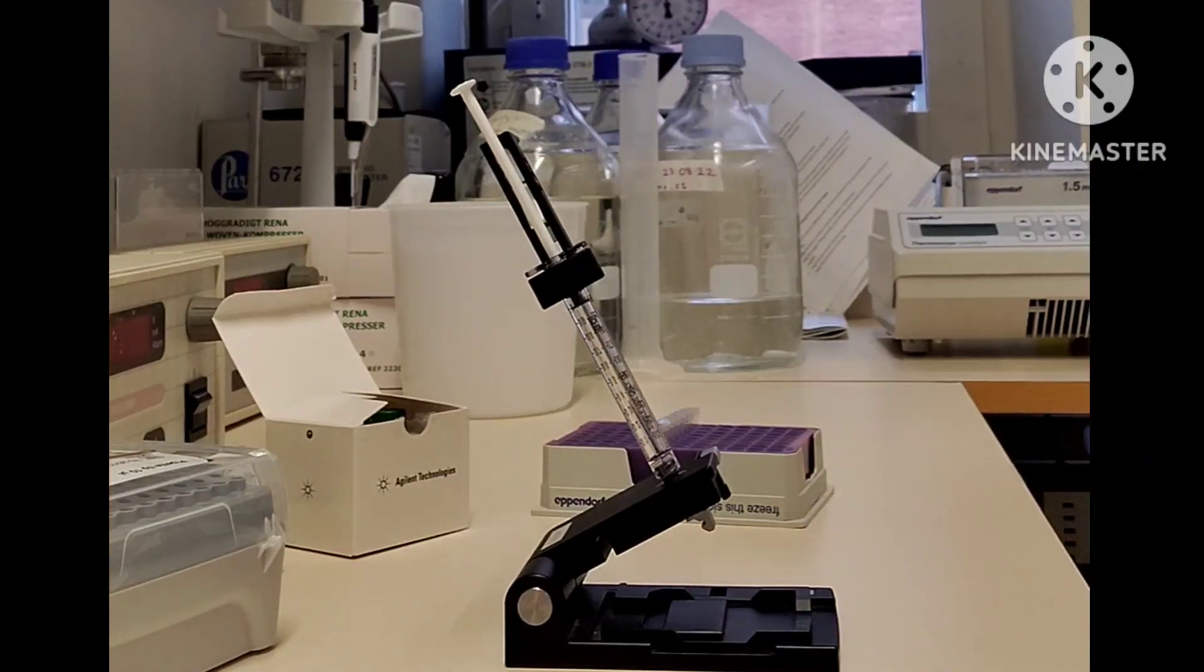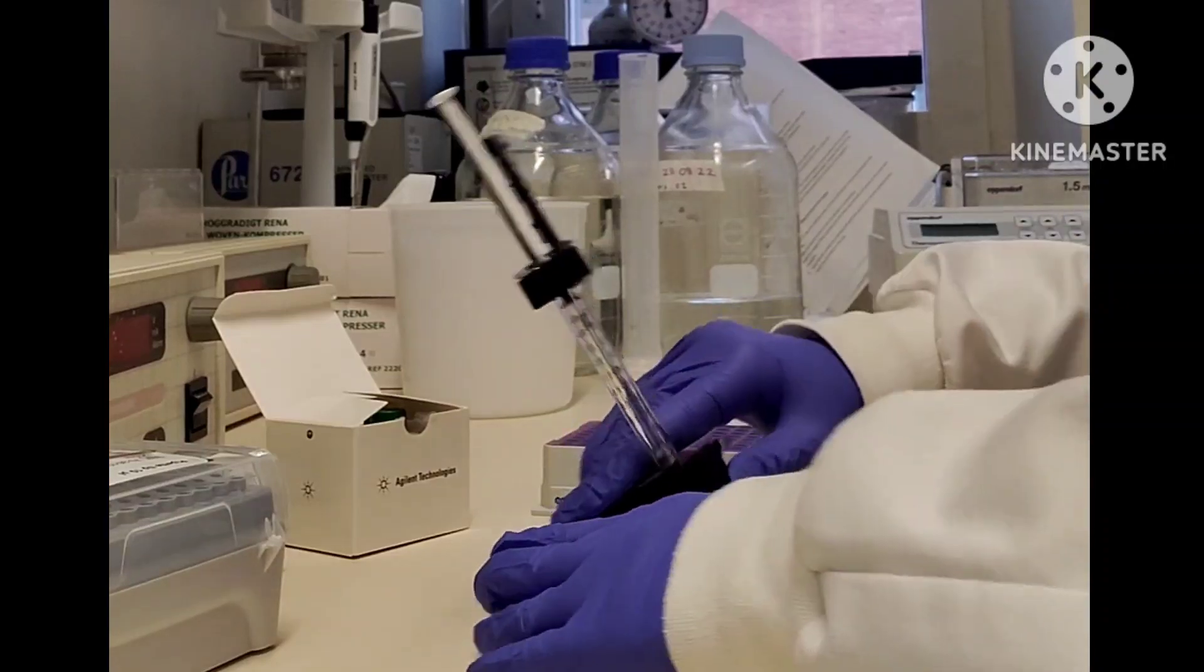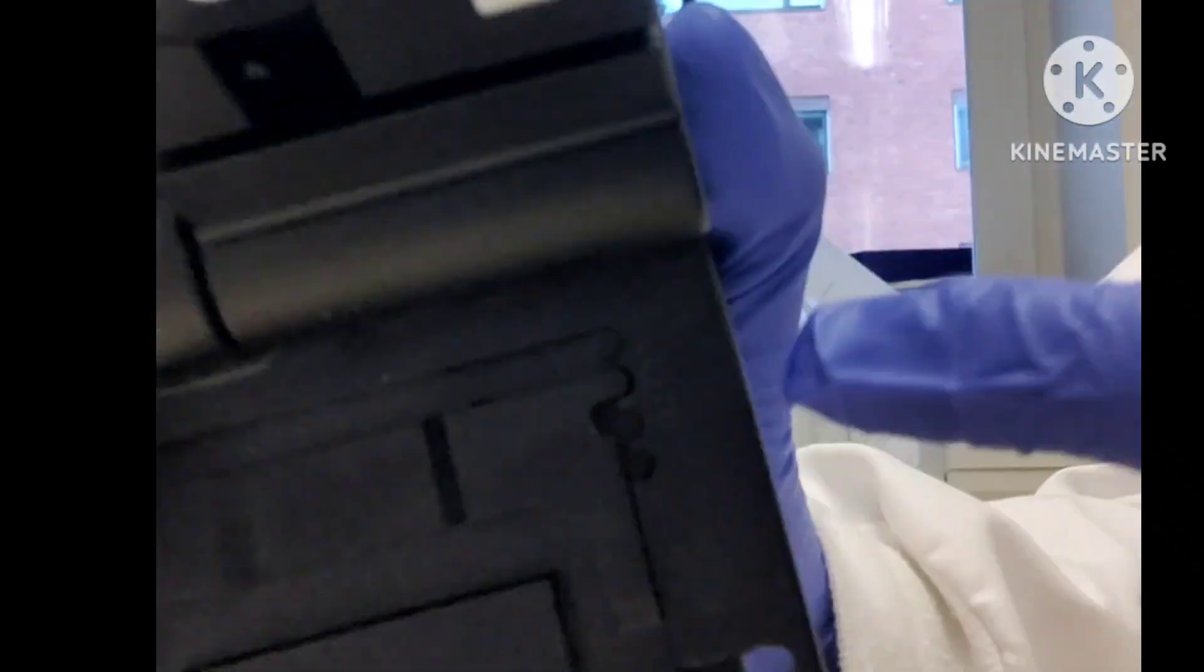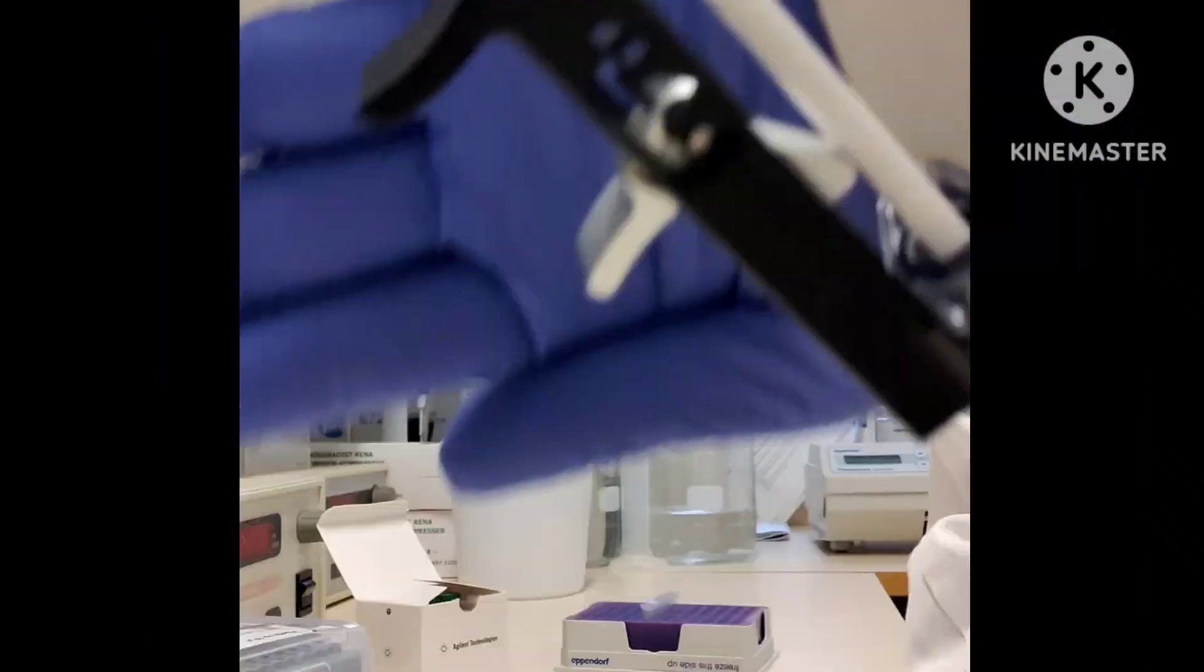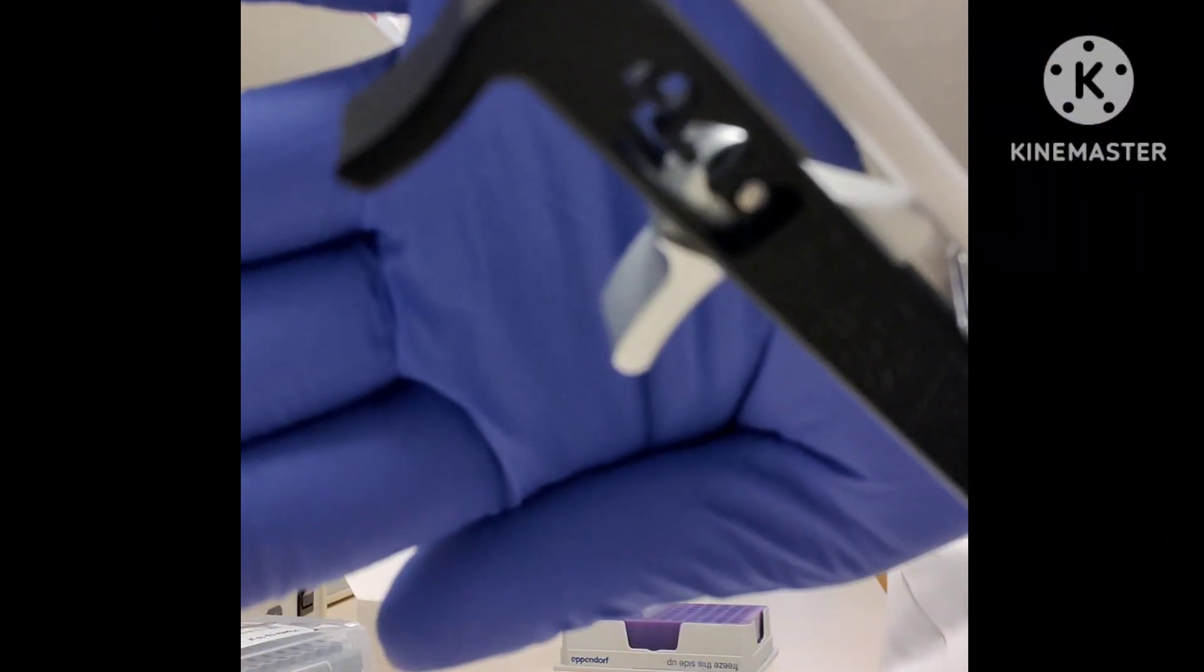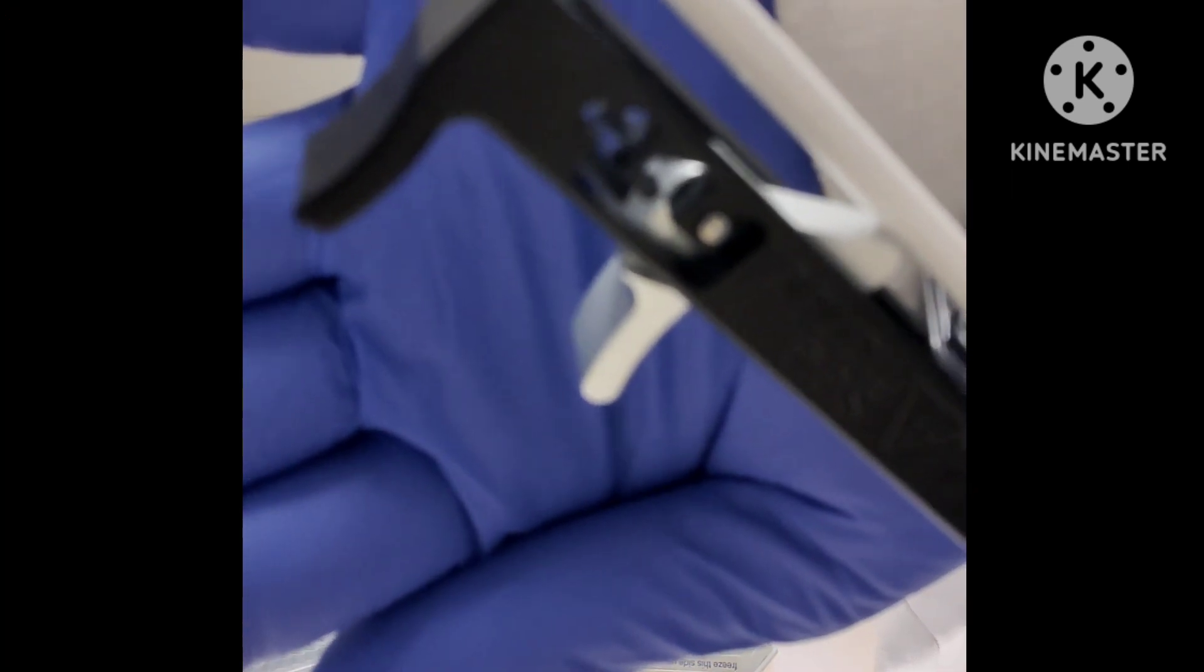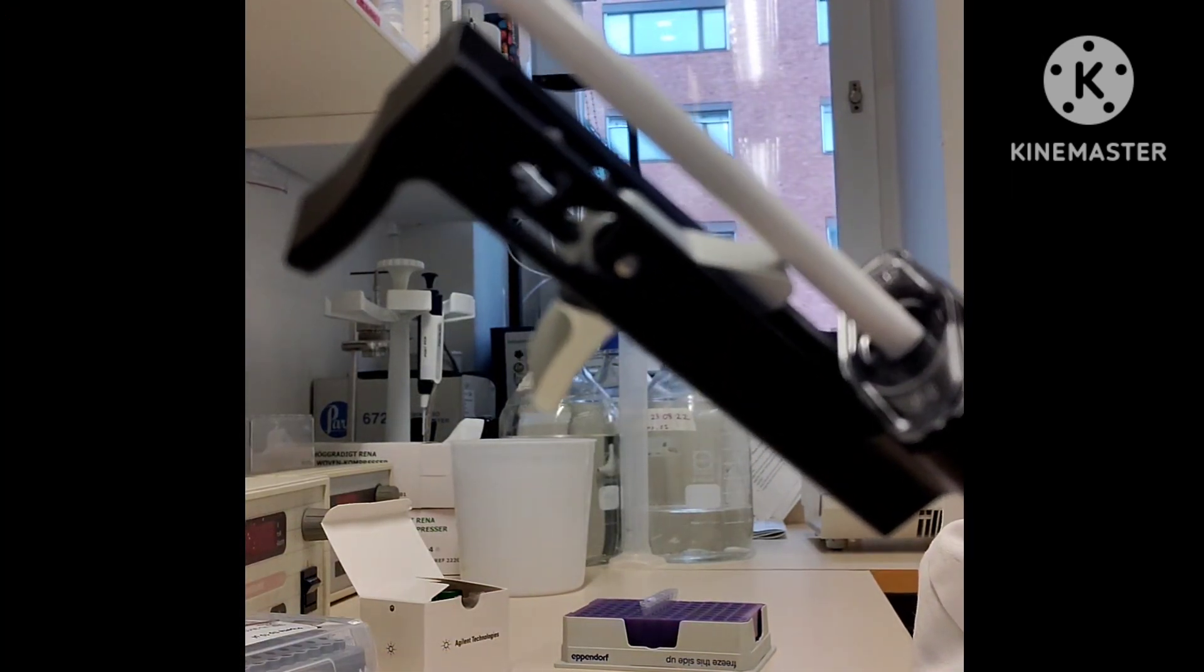Now let's prepare the chip. Just ensure that the base plate is set to the correct position. Let's suppose for this I need the C position, and this syringe clip position is at the correct position, at the last knob.